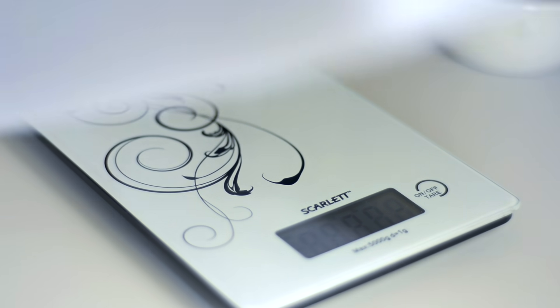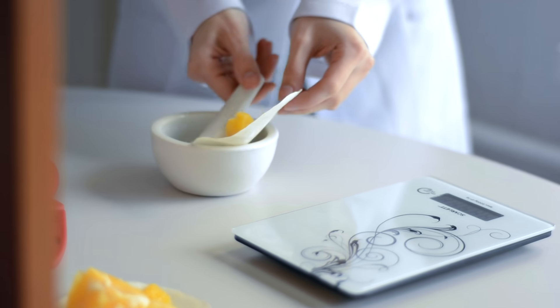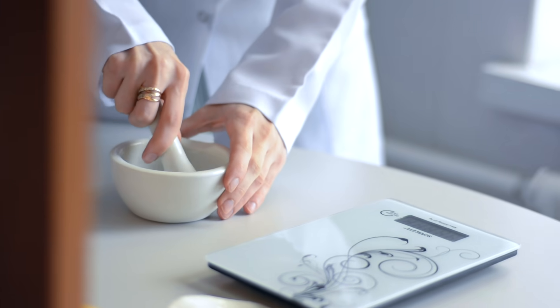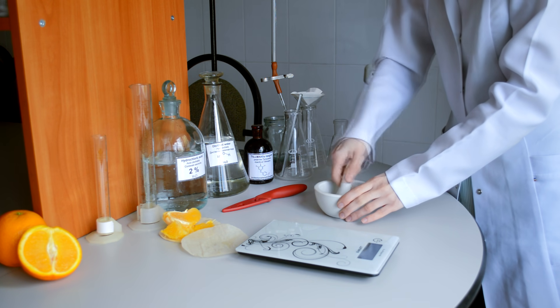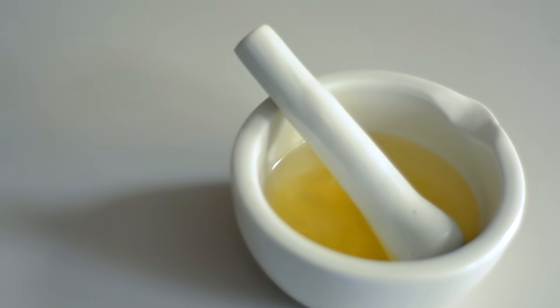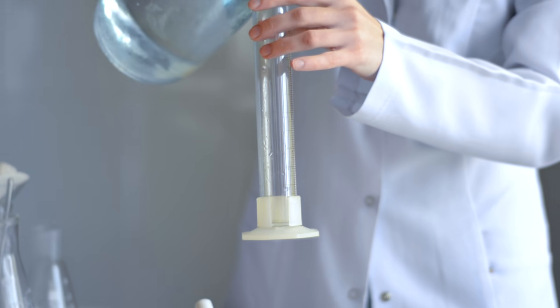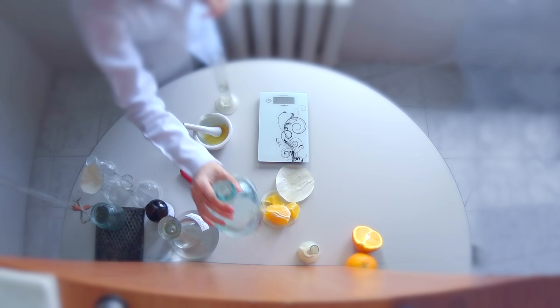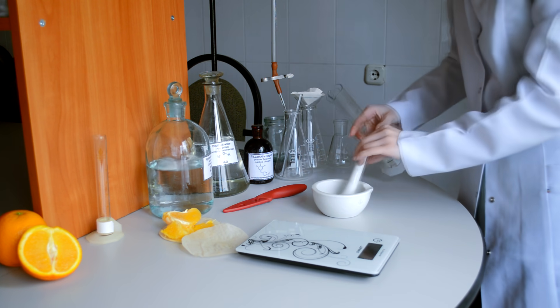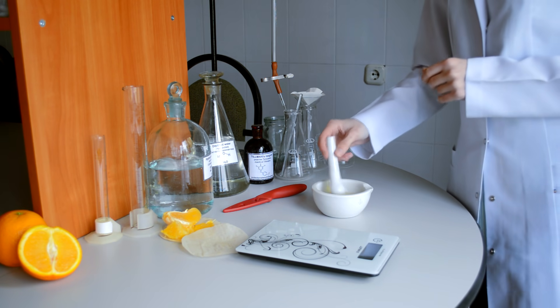Take 10 grams of oranges and then we mash them up. When we mash them we need to add a solution of 2% hydrochloric acid in the volume of 50 milliliters. Then we leave it for half an hour for extraction to take place.